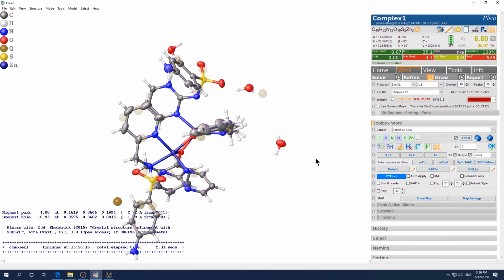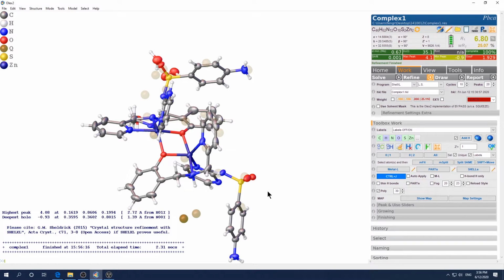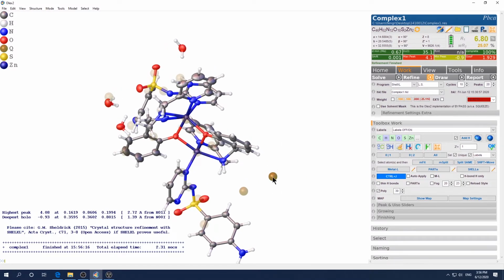the purpose I ignore the water here is I want to show you how to use squeeze or solvent mask to take care of the disordered solvent molecule. So if you know for sure, based on the synthesis procedure or the procedure to grow the crystals, that you only have water, and if you attempted to model this as water but failed because it's so diffuse, it does not settle down in a specific position. It just keeps stretching that ellipsoid so large, just doesn't settle down.